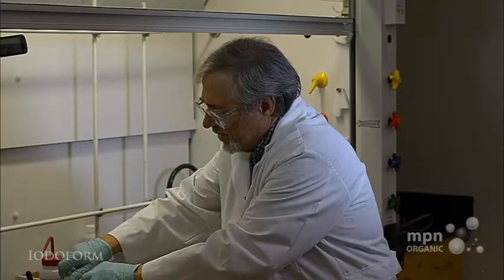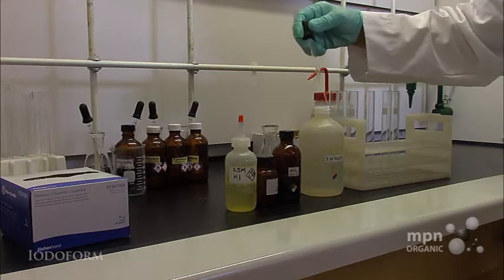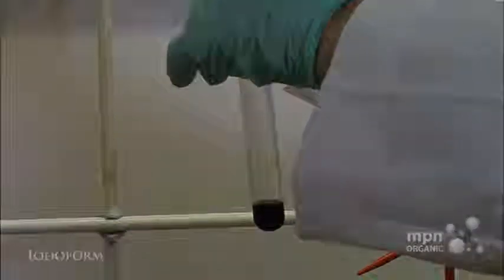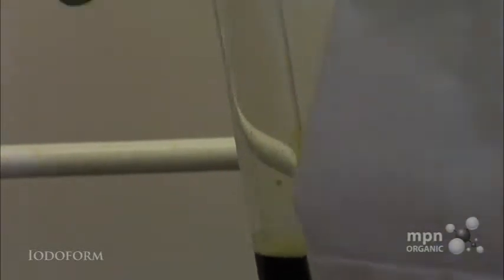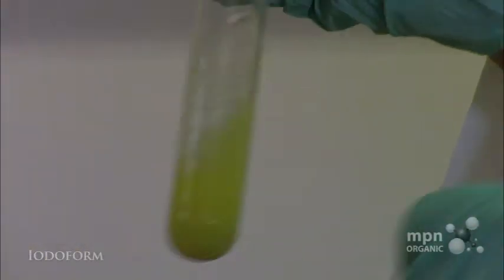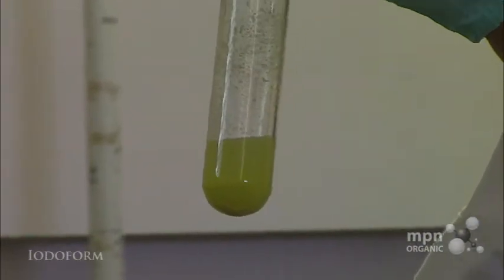Now I want to add to it some sodium hydroxide. I'm just going to take a little bit of sodium hydroxide and drop it in, and you'll see that the reaction in this case is almost immediate. Shake that up. And the white solid, you see, actually eventually becomes very yellowish as it coagulates and sinks to the bottom of the tube.